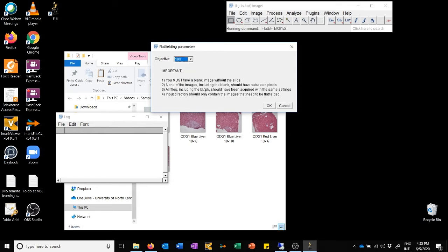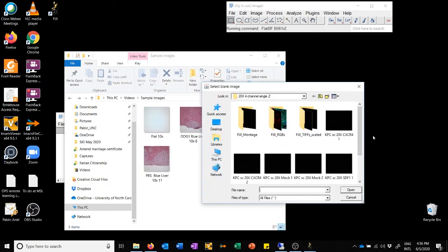It also reminds us that we must have taken a blank image, that none of the images, including the blank, should have saturated pixels. All files, including the blank, should have been acquired with the same settings. And the input directory should only contain the images that need to be flat fielded and nothing else. So there should be no other subfolders, no text files, nothing that you don't want to run through this flat fielding algorithm. So let's say OK.